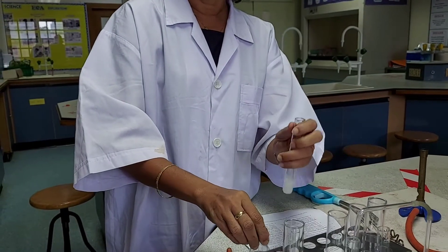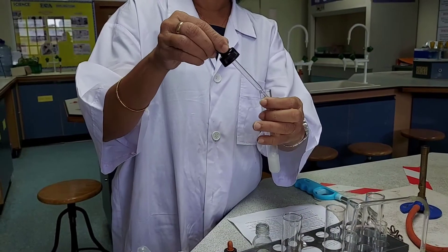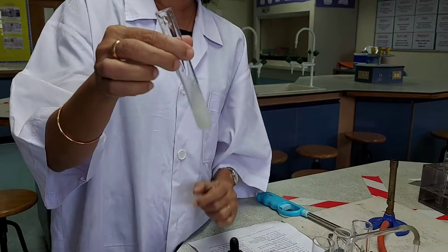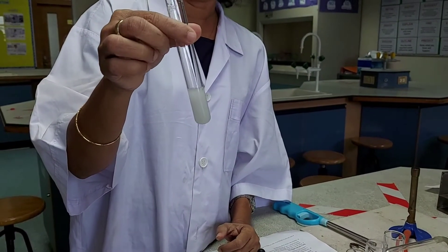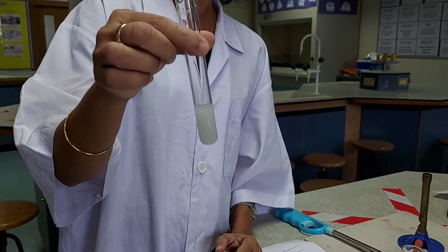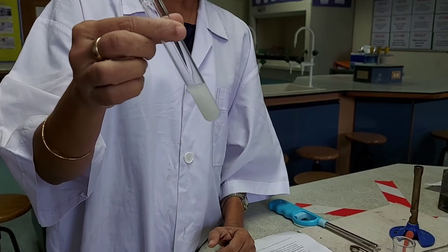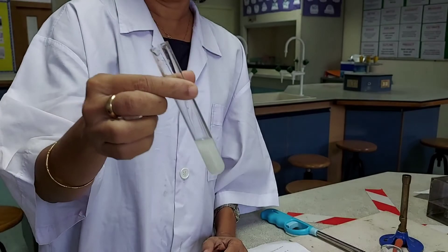If you add excess acid to the given solution, the precipitate still remains — it is not soluble in excess acid. So this is a test for the sulphate ion. A white precipitate with barium nitrate or barium chloride is an indication of barium sulphate formed in the given reaction.